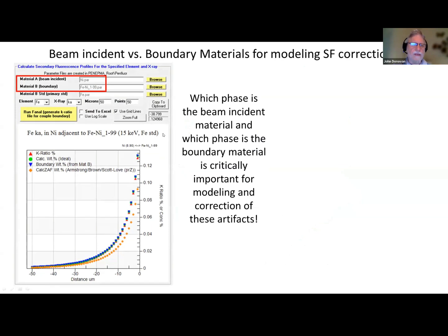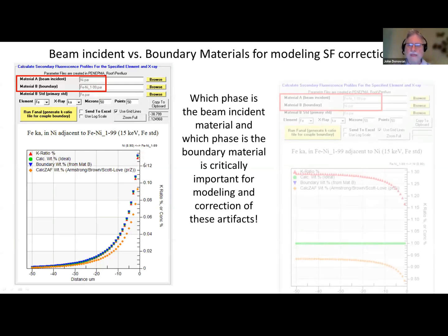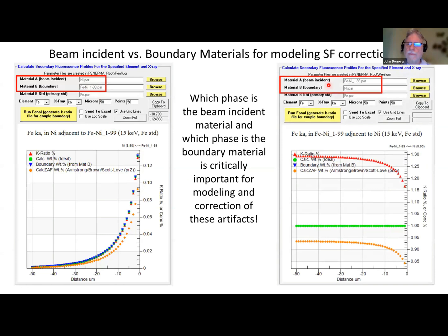So here, for example, we're measuring iron in nickel adjacent to an iron-nickel alloy, and you see we get a positive artifact of about 1200 ppm at 1 micron from the boundary. And here we swap those. We're measuring iron still, but now the iron in the iron-nickel alloy adjacent to the nickel, and we get the negative artifact. So keep straight in your mind which is the beam incident material and which is the boundary material, because the physics will be completely different.